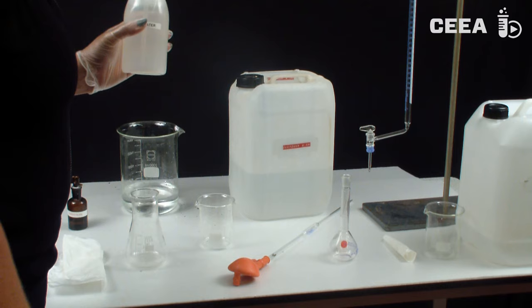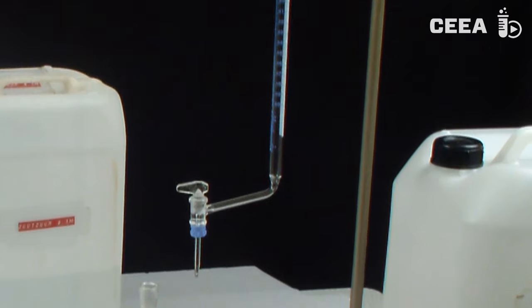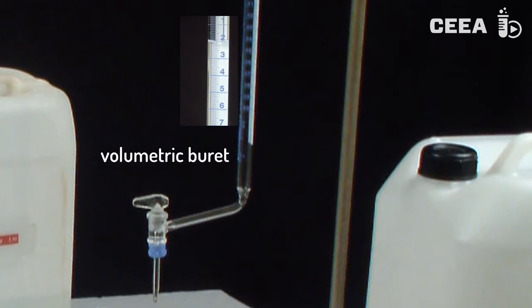The titration itself is conducted with a volumetric burette. The burette is a cylindrical tube with a volumetric scale, the scale width being 0.1 milliliters.